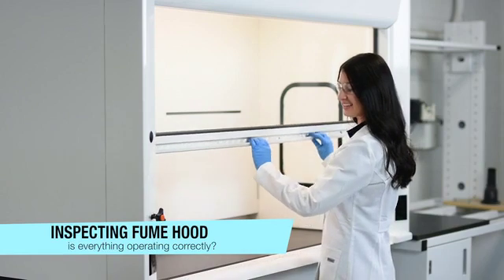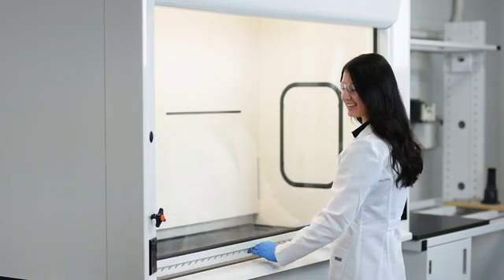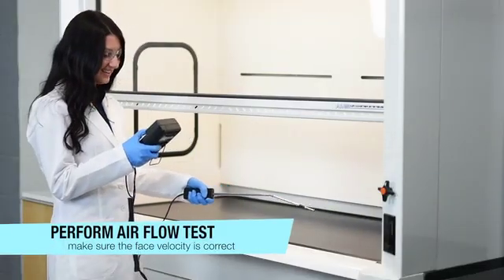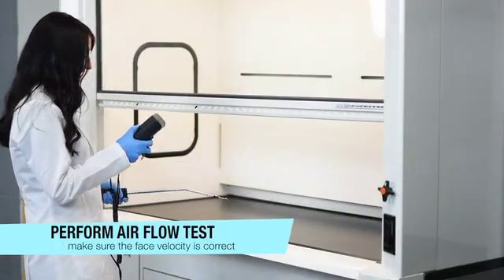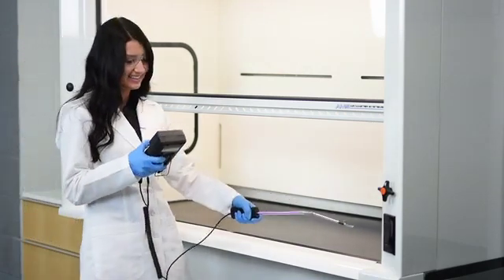Let's inspect the sash first. It should open and close correctly. There should not be any issues with your sash as this protects your face. It is also very important to inspect your airflow to make sure your hood is functioning correctly. If you do not have the appropriate equipment, you can always hire a service to come do this.